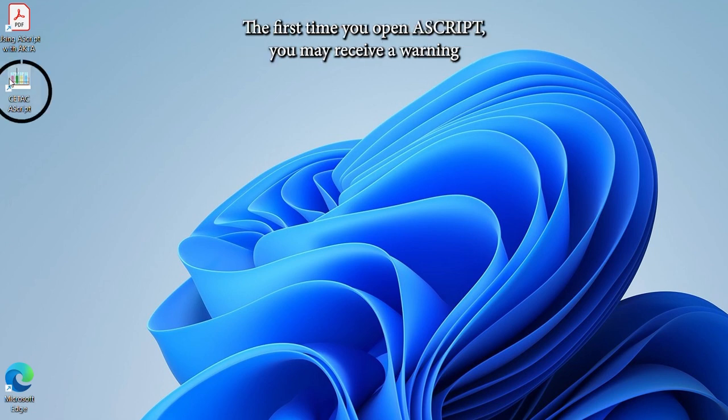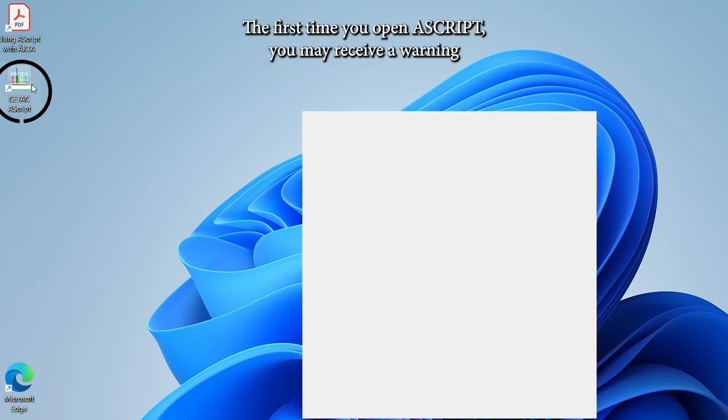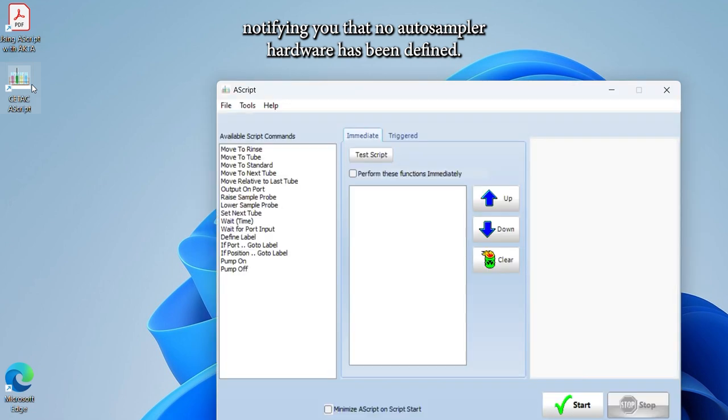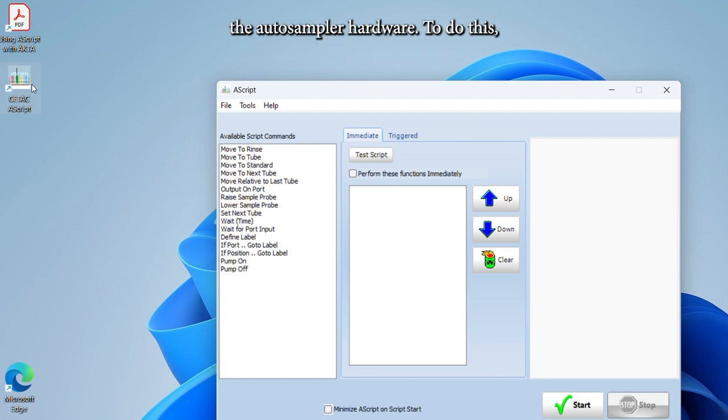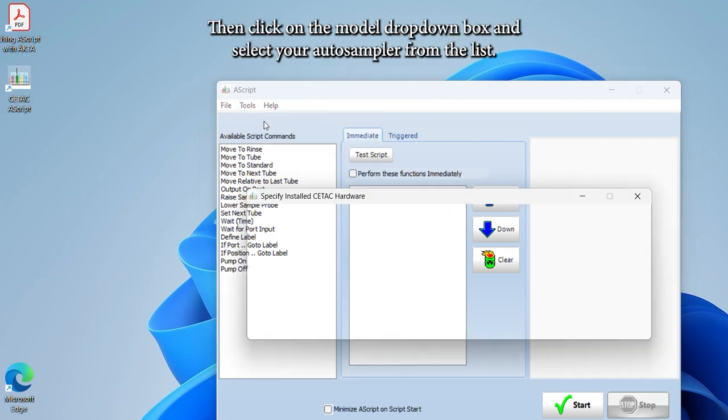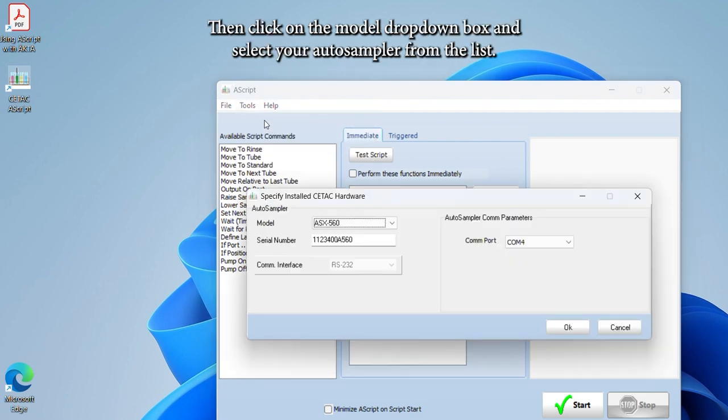The first time you open ASCRIPT, you may receive a warning notifying you that no auto-sampler hardware has been defined. You can click OK to clear this message, and we can then define the auto-sampler hardware. To do this, open the Tools menu and select Hardware Setup. Then, click on the Model drop-down box and select your auto-sampler from the list.